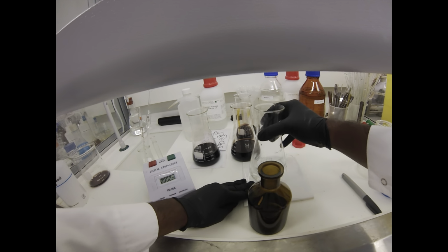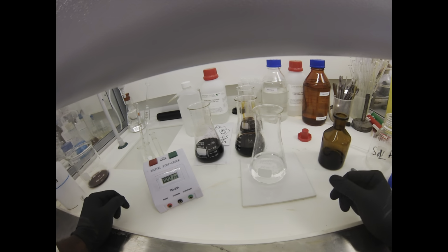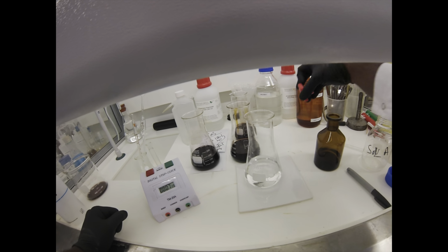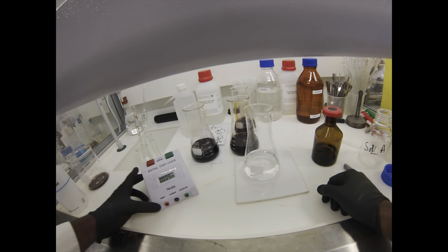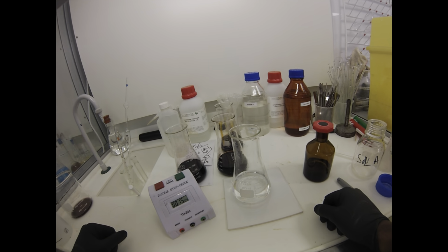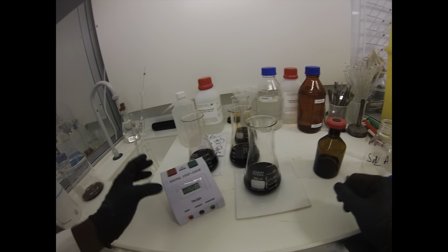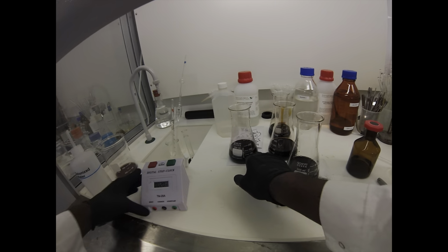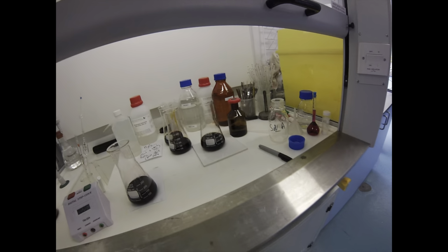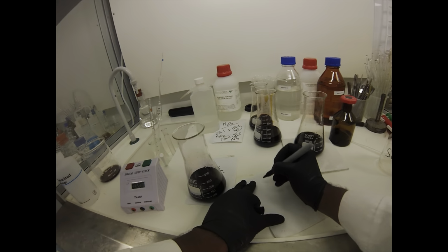Bumped up the concentration of thiosulfate. So in we go and start. That's about 20 seconds on there, which is pretty spot on. I do know that my consistency between runs and my swirling wasn't exactly perfect. But still, a really, really nice tweak on this reaction here.